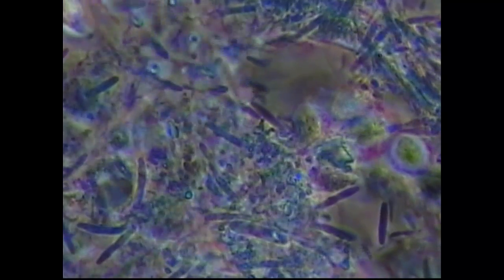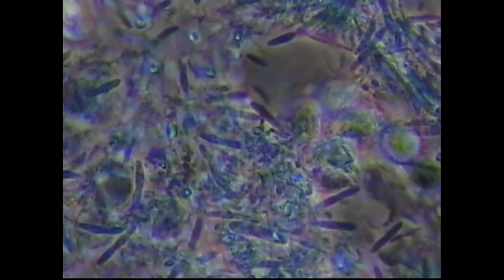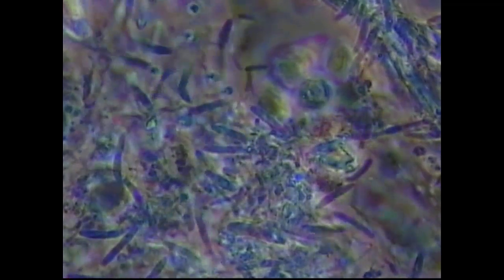Anyway, you get a little better contrast in what's going on, and this amoeba that's on the right side of the screen, you can actually see some detail in the food vacuoles that it has inside the amoeba. And a little bit later on, I'm going to show you a spirochete that got trapped in one of these amoeba, which is really, really interesting, because we tend to think of them on the same team, causing disease, and one does not ingest the other. But I'll show that to you in a few minutes.